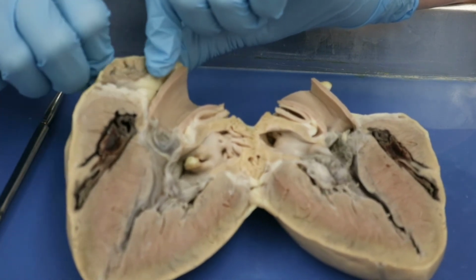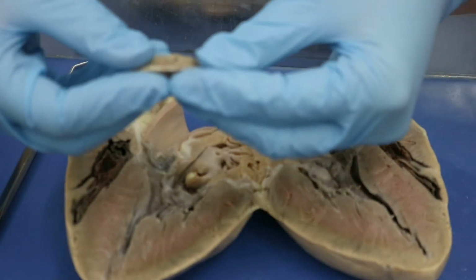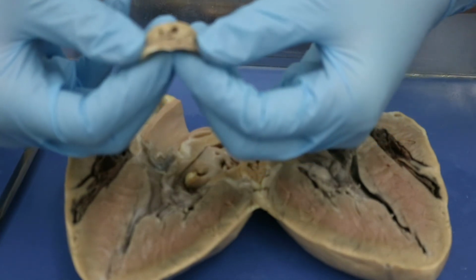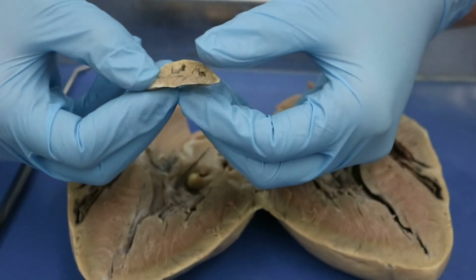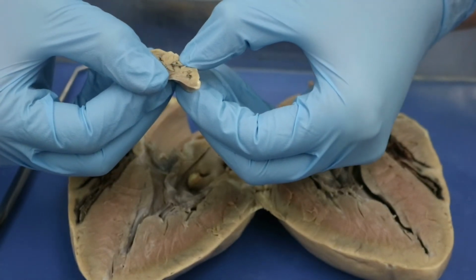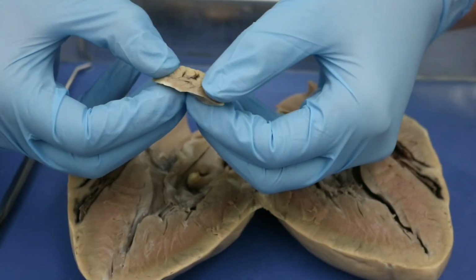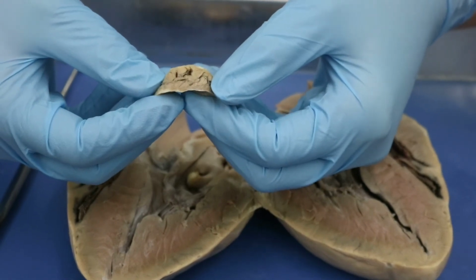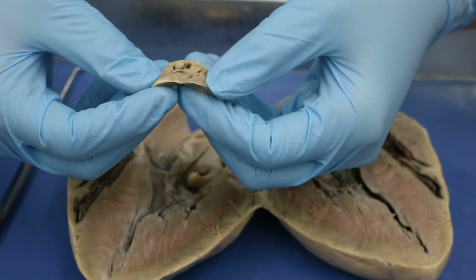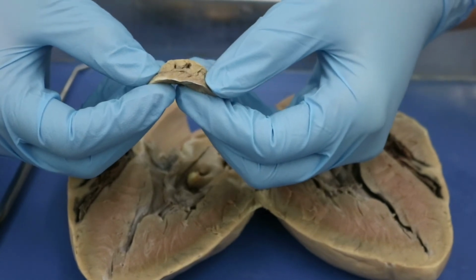It's not showing super well. Let me go ahead and do it with the piece that's cut off. So you can see that there is kind of rough areas inside of there. So this is tissue that could be opened up in the case of needing more space to hold blood. Okay, so that is the auricle there.